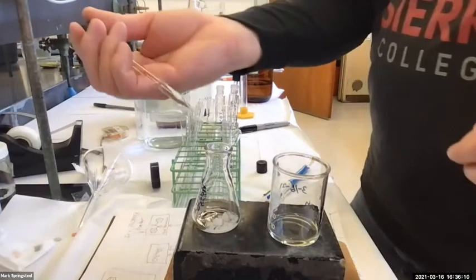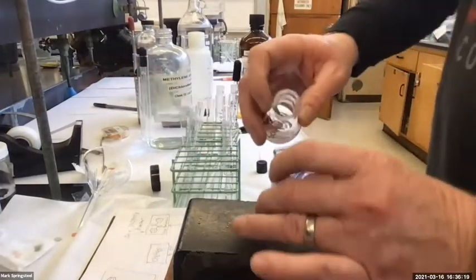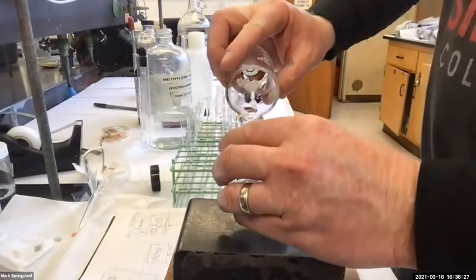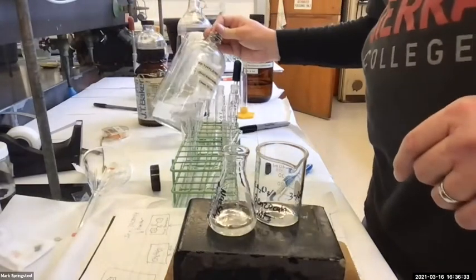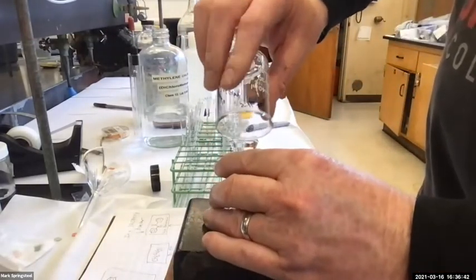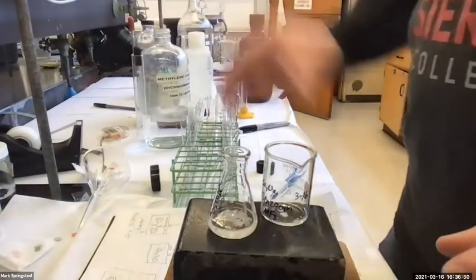And as I did last time, I'm going to rinse this with some fresh methylene chloride. You can see this process of extraction has a lot of repetitive things to it. So the more, oh my goodness, I'm talking too much. I did exactly what I was saying. Oh, you know what I also did? I'm rushing it. Okay, no big deal. I also didn't weigh this beaker. Oh yeah, I was going to ask, are we massing this one? Yeah, I should have. Nothing's lost. It's all good.